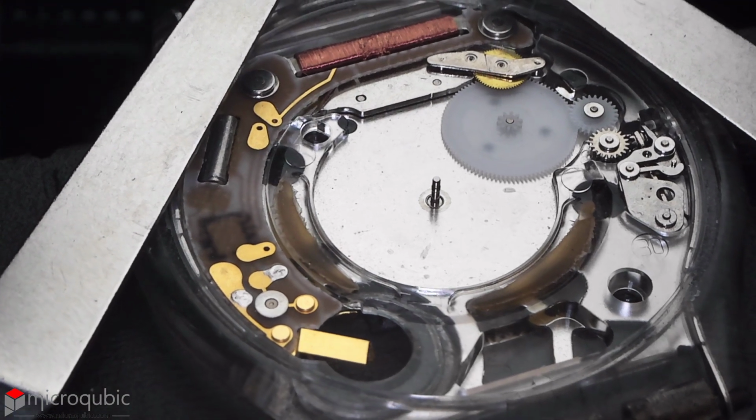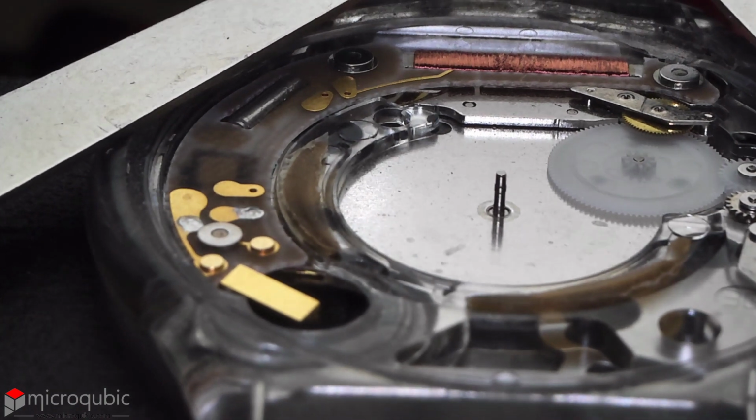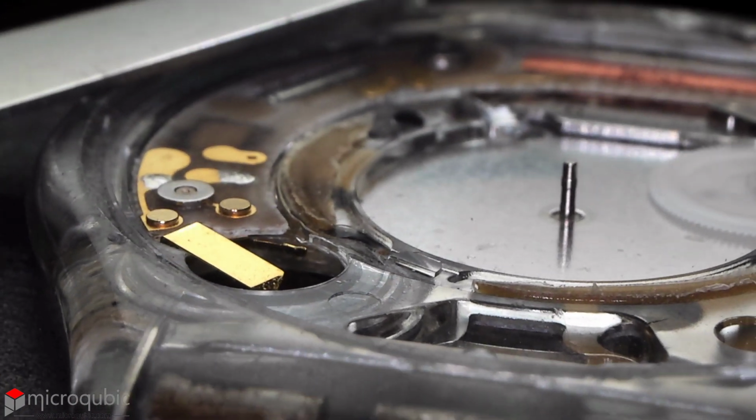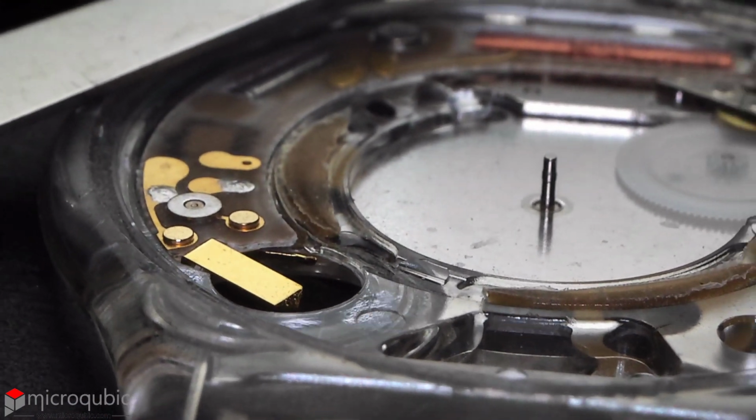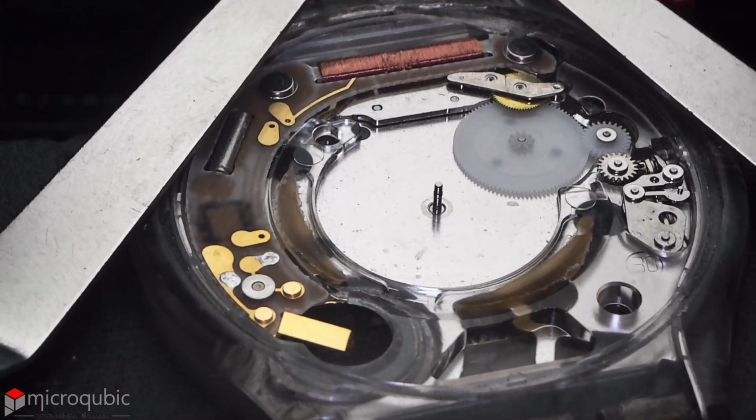Then stop the recording. For the actuators, you can wait until the program movement is finished or press the emergency stop button at any time. Then use your favorite video editing software to speed up the video. You can cut the beginning and the end if needed. Here is the result of our recording.